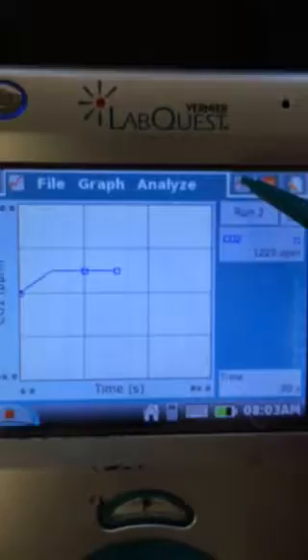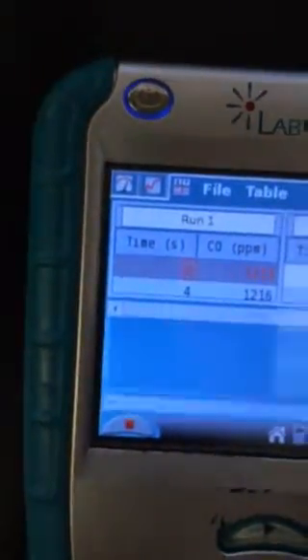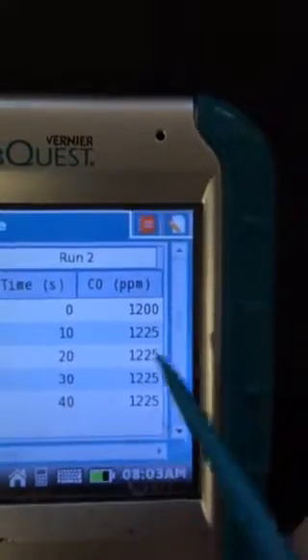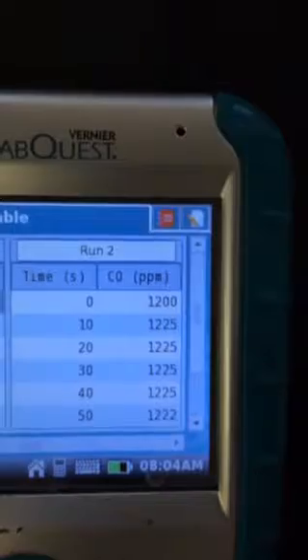Well, there's a little X and Y symbol right here. And it's actually recording, so we're on run 2, so we'll look there. It'll allow me to name it, but I don't really want to do that. And you see here the parts per million that it's recording for run 2 every 10 seconds. I can average these, but guess what? I don't even really need to average it because it looks like most of them are around 1225.